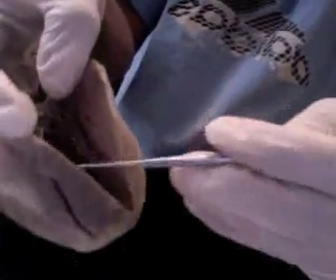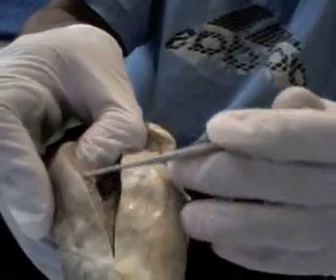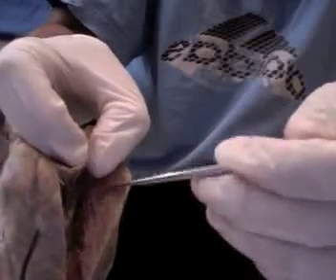You also have your myocardial walls, which is the myocardium. This side is your left one. And on this side, we have the right. The left is thicker because it has to pump pressure to the systemic body, which requires a lot more pressure than the pressure that is in your lungs for your right ventricle to pump blood through.